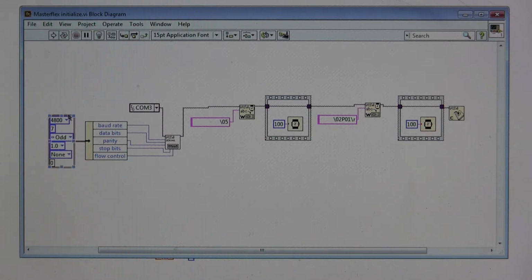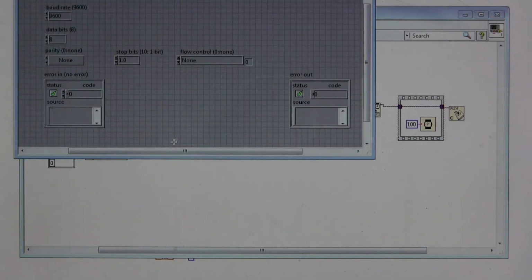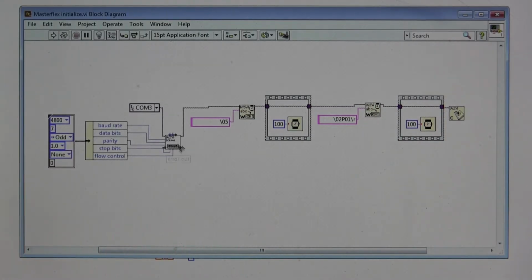What it has here are the parameters for the serial connection, the RS-232. It's got baud rate, data bits, parity, stop bits, flow control, etc. So those are set right here and separated into different data streams and input into this VISA configure serial port. So we configure the serial port with all of these settings.